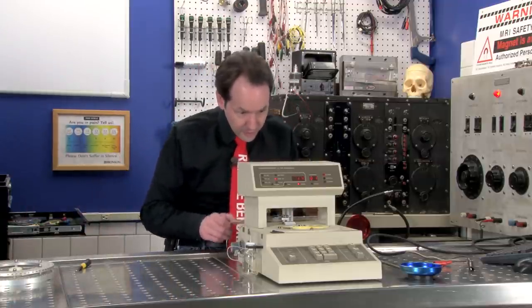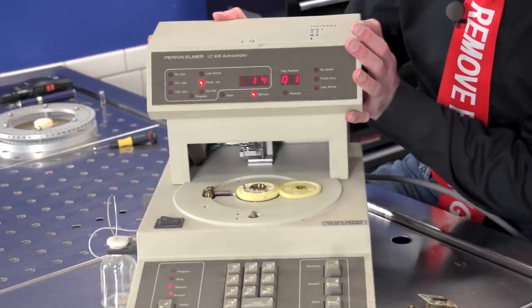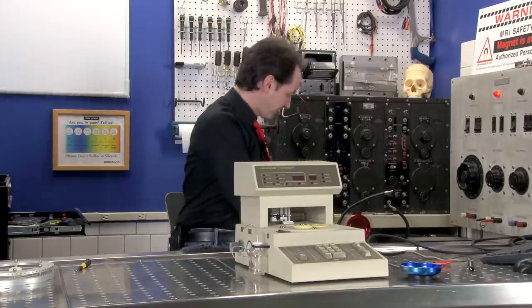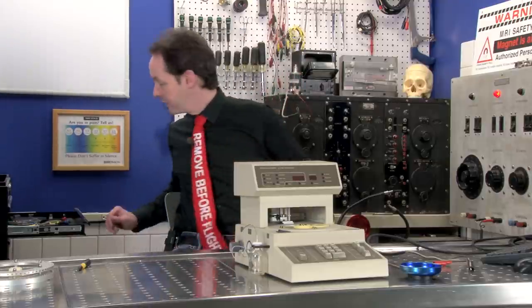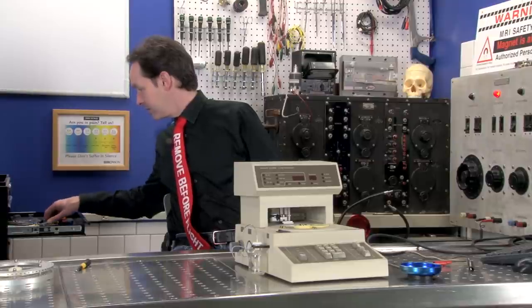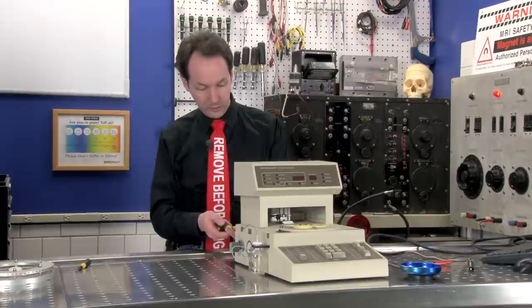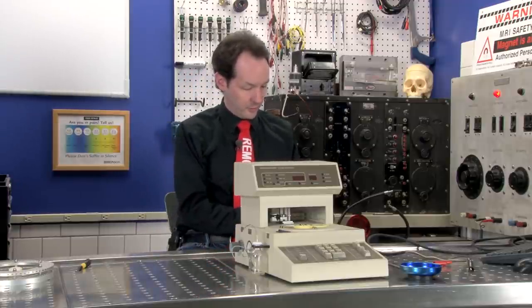What can we dig into next? I don't think we're going to get anywhere. Yeah, this is all casting. There's no screws on the outside. So, I'll take the plug off of it. Set that aside for a moment and grab a screwdriver that does not suck.